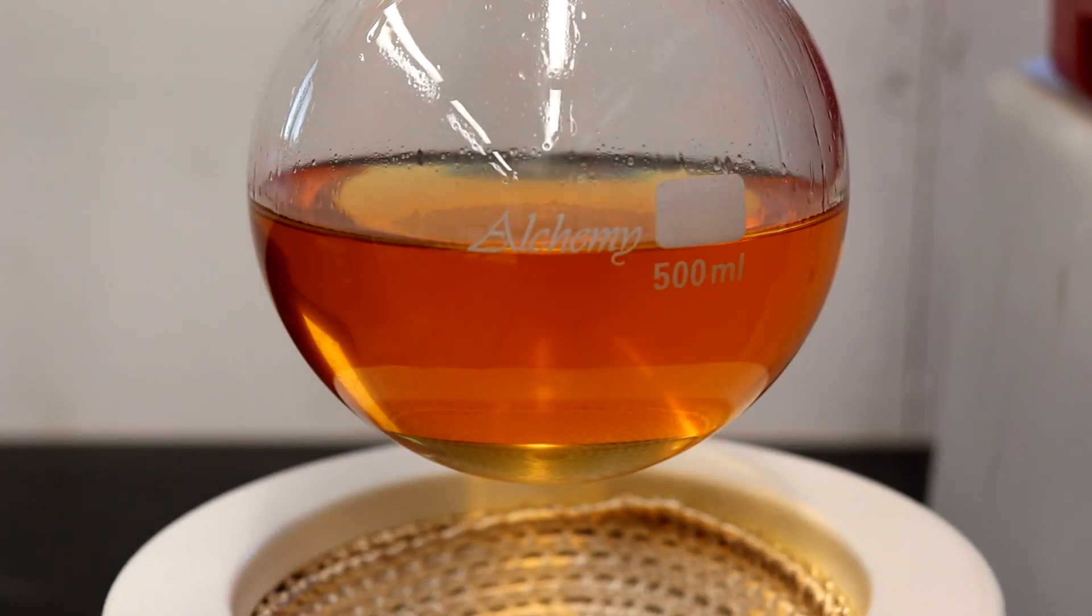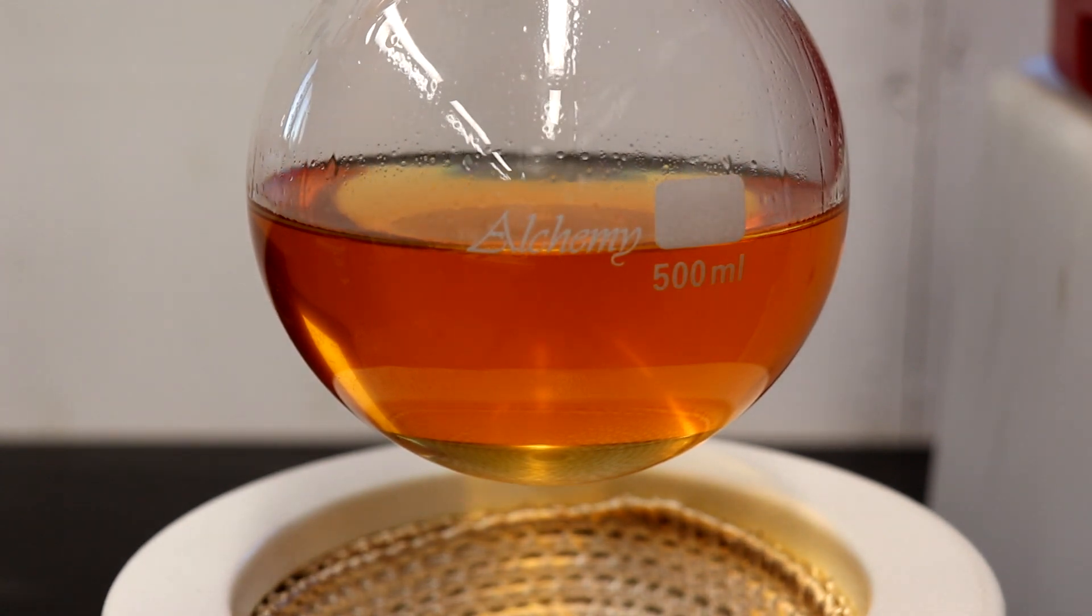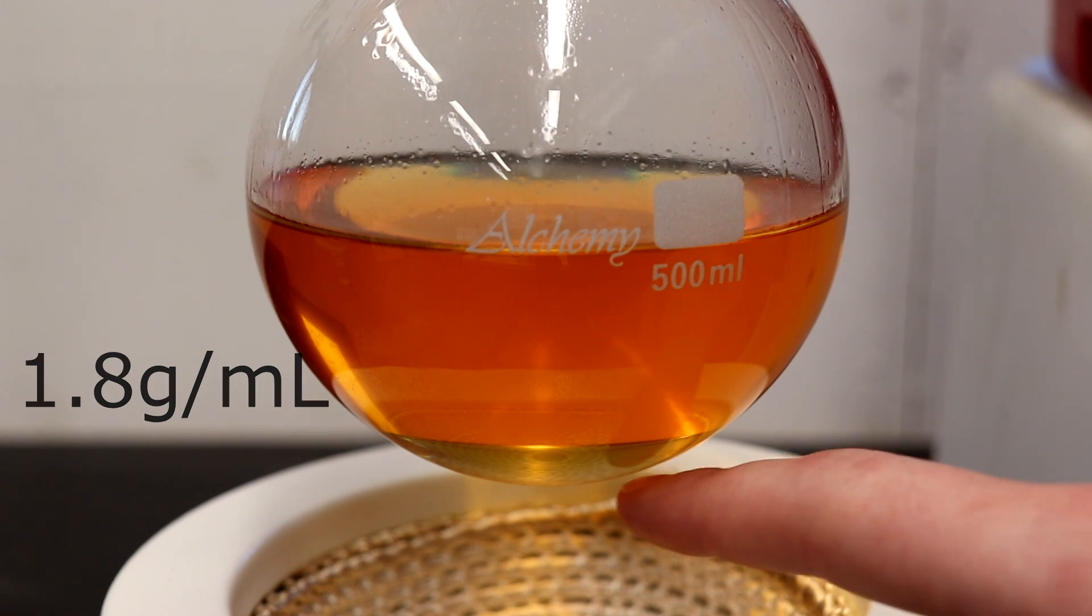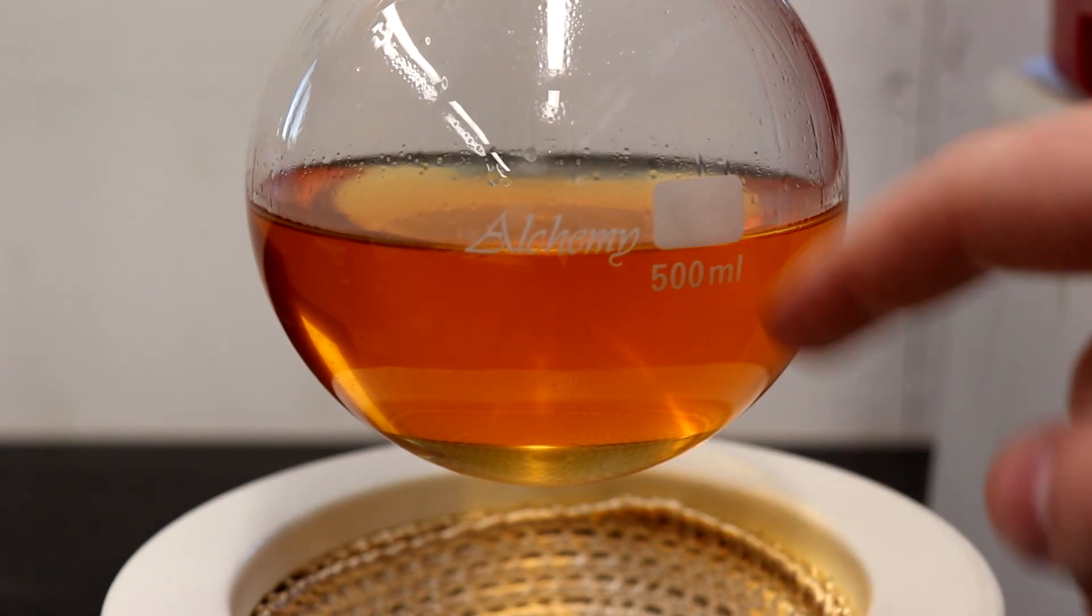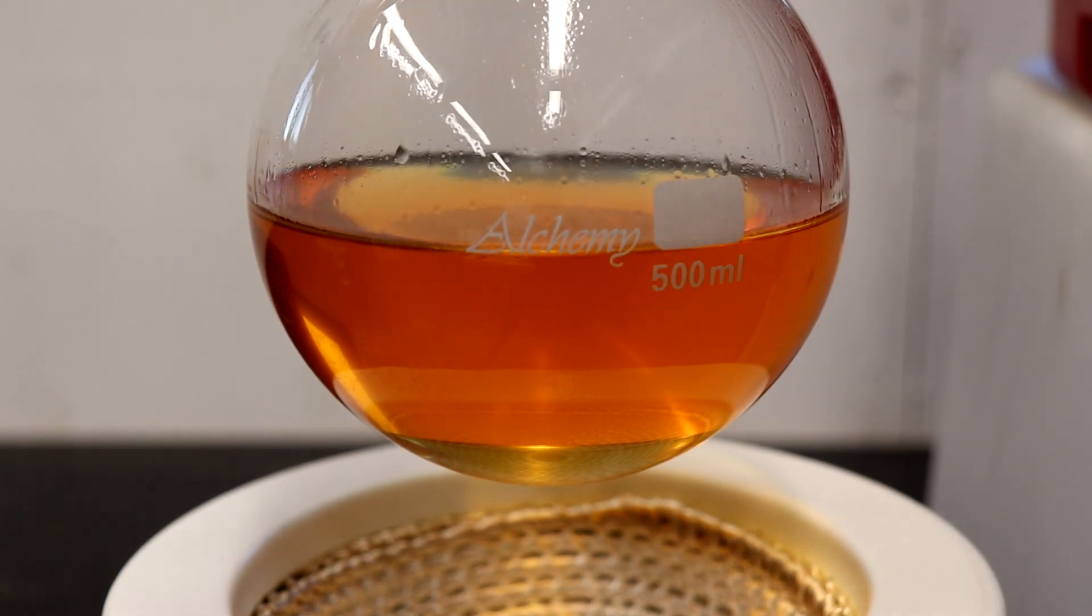I've just stopped the reflux after just over four hours, and you can see the layers have already separated out. At the bottom, we have our dense 1,4-dibromobutane, and we have the aqueous layer up here. So once this all cools down, I'll transfer it to a separatory funnel.